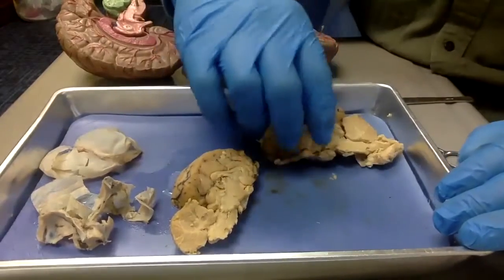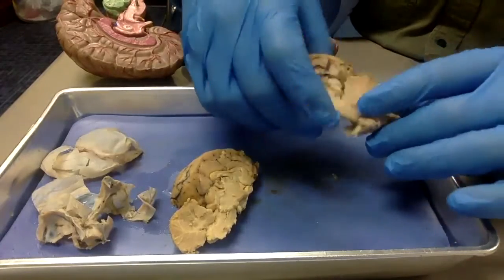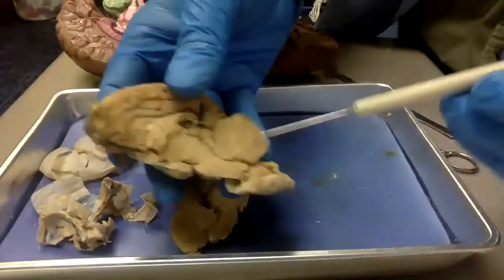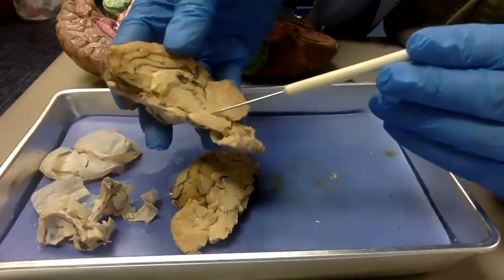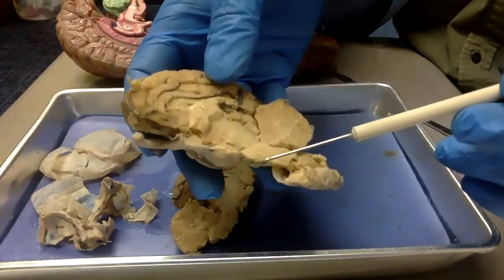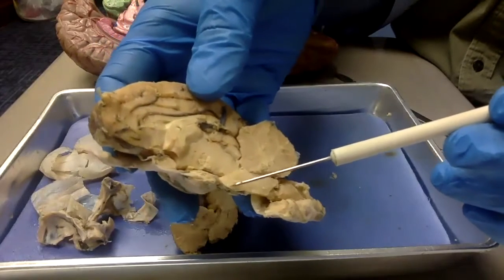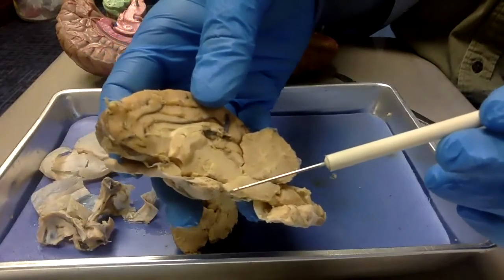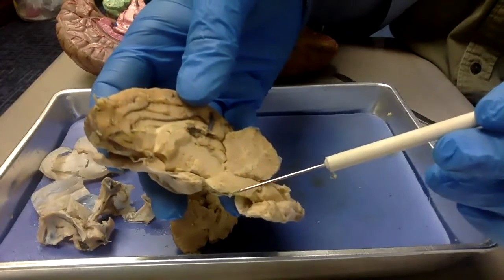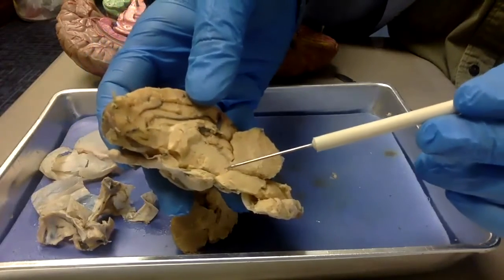Because I cut a bit of the brainstem in a haphazard, jagged kind of way, I wanted to show you the pons, which would be around here, but it's not really showing. Normally it shows pretty clearly. On camera anyway, I don't think it is, but with my real eyes I see a slight shade difference, and that would be the pons. And anything under here would be the medulla oblongata, and midbrain up in this region.